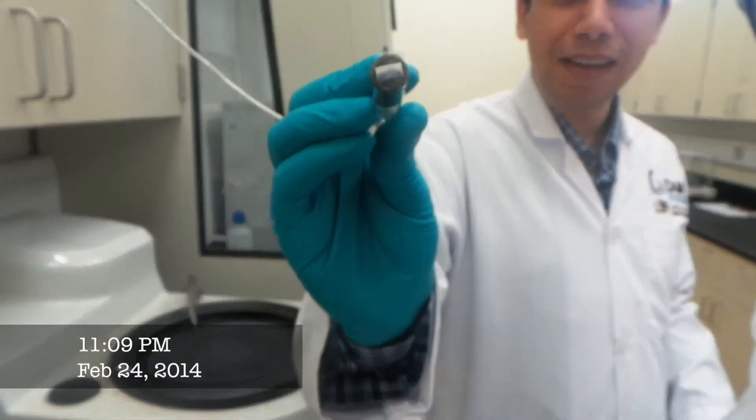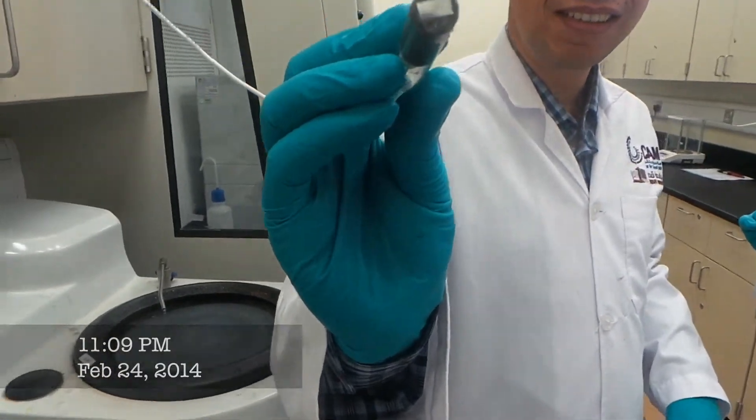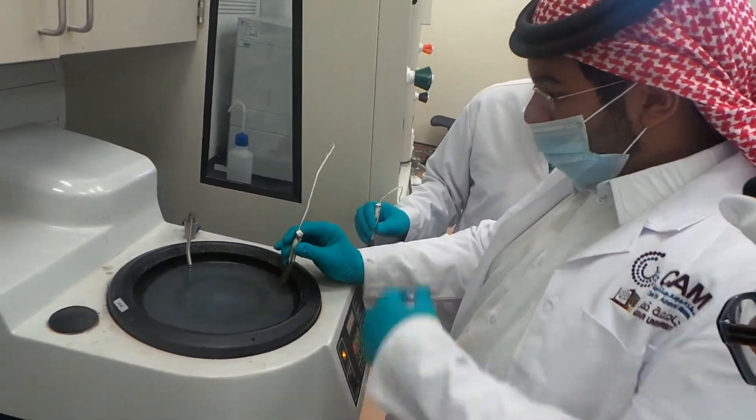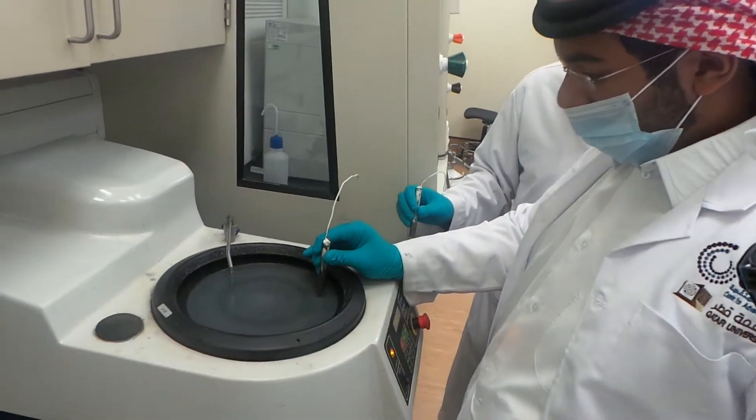Hello, I am Ahmed. As you can see me here, polishing the surface of the electrodes to clean it from dirt.